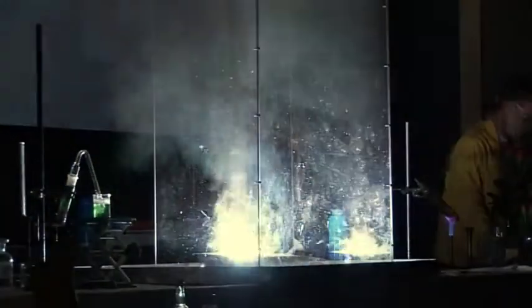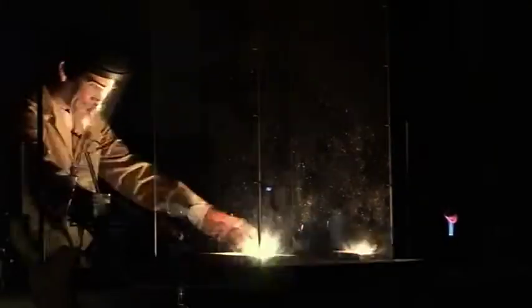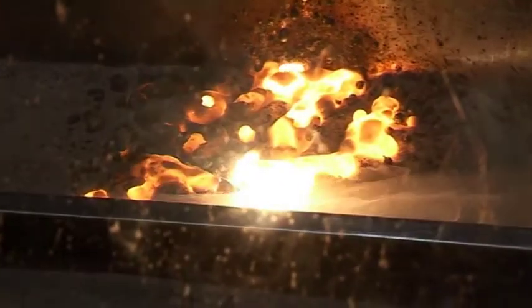Well, I think that was fairly conclusive. And if we just keep the lights down for a second — the heat from that reaction has actually caused some of the remaining iron to melt, and in here we have molten iron.